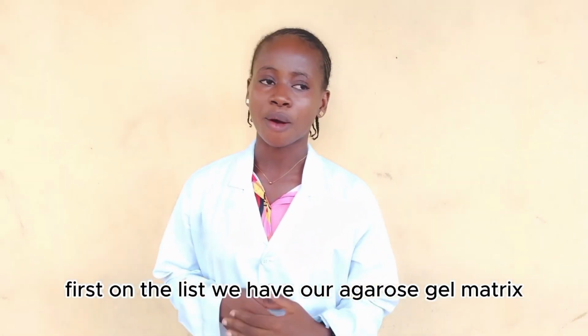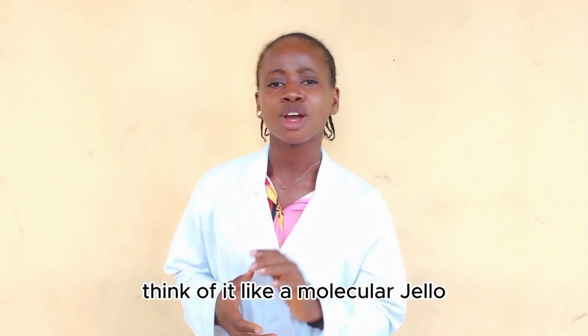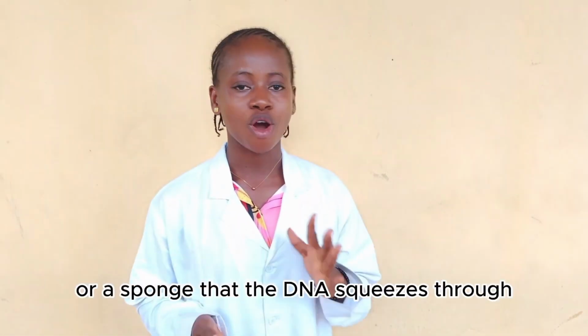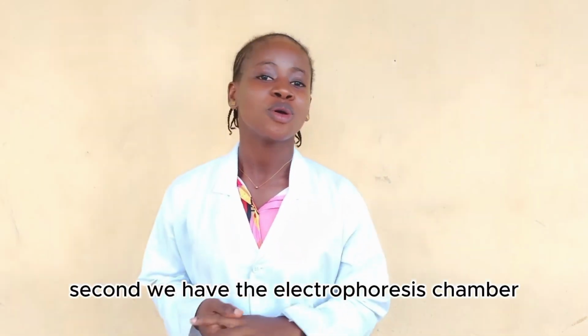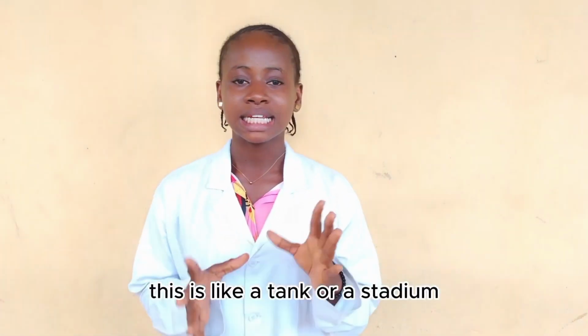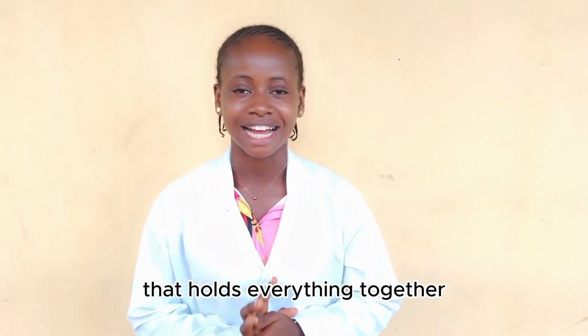First on the list, we have our agarose gel matrix. This is our racetrack. Now think of it like a molecular jello or a sponge that the DNA squeezes through. Second, we have the electrophoresis chamber. This is like a tank or a stadium that holds everything together.